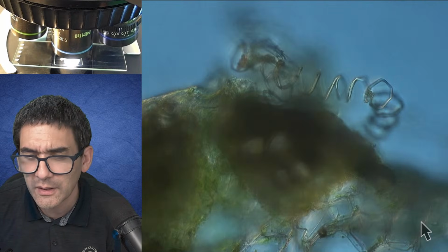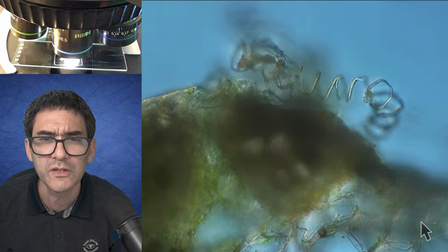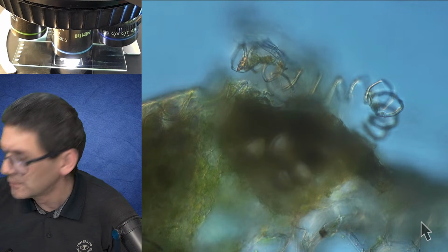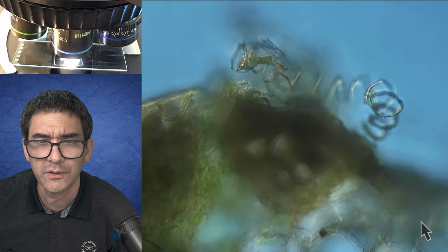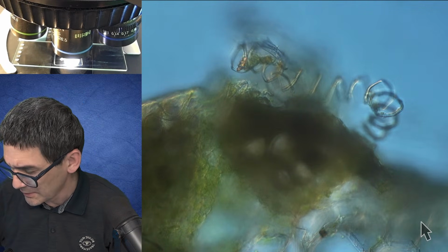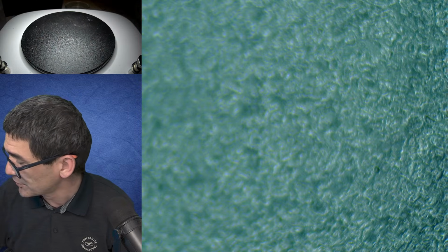So what time is it? Okay, half an hour now. I'm going to slowly move ahead a little bit. I do want to show you, just for the fun of it, what else I found now under the stereo microscope. Let me turn on the stereo microscope.